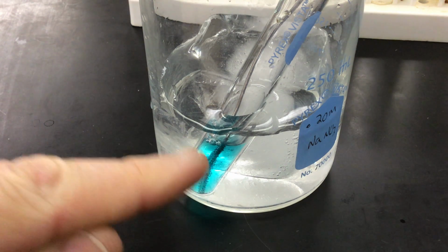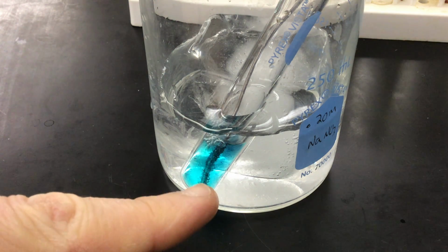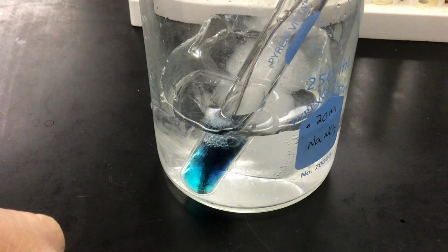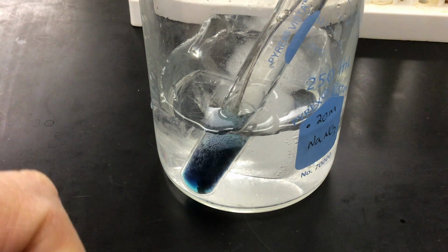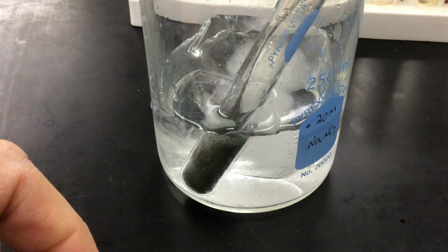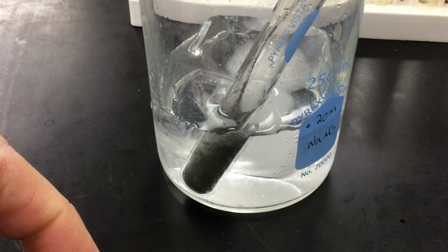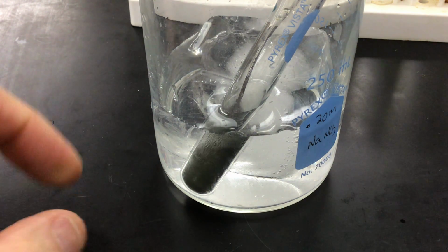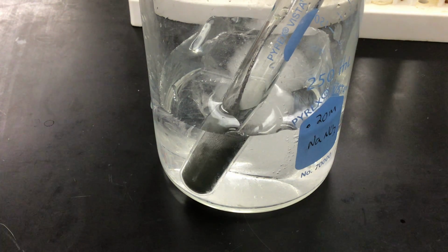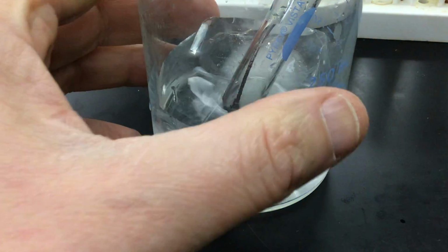And we're going to start to see, again, that's one way of indicating a chemical reaction taking place, the formation of bubbles. But also you'll notice that gray... you can see now, see how aggressive the reaction has become. And a good thing that this reaction was put in water to try to control it. Sometimes I've seen this reaction kind of bubble and almost shoot out of the test tube. Okay. Now this reaction takes a long time to finalize.